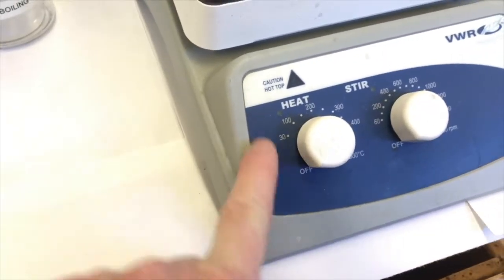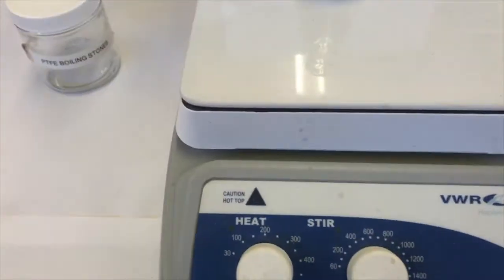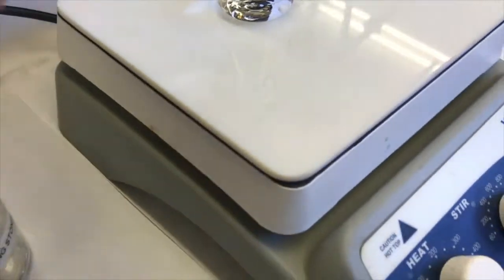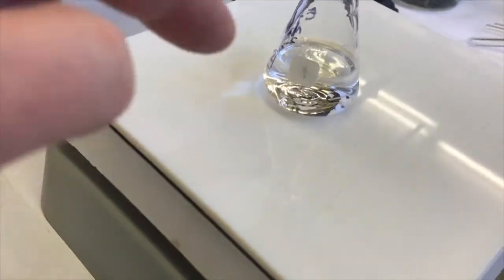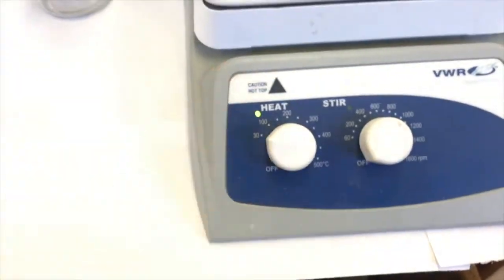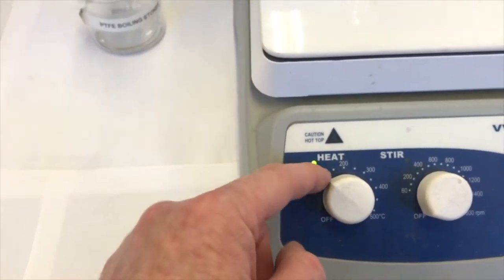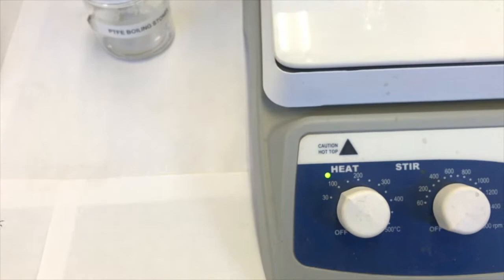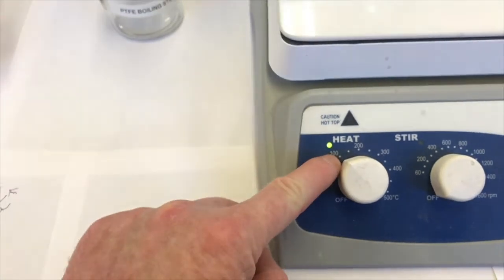There's the heat knob that'll turn on the heat, and then there's a stir knob. We're not going to use the stir this time because we have boiling stones. If we wanted to stir this solution, we could add something called a stir bar. It's a little piece of magnet with Teflon coating on it. And then underneath this stir plate, I'll show you later, it has a magnet that'll spin and stir your solution. So for now though, we'll just turn the heat on. How do we do it? We just turn this dial until we see a green dot. So what does that green dot mean? The green dot means that whatever value I have this set to, it's not quite at that temperature, and it's heating to get there. So right now, I believe, yeah, this is supposed to be 100 degrees Celsius.